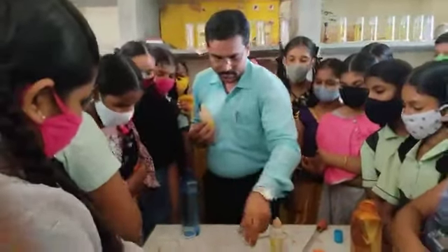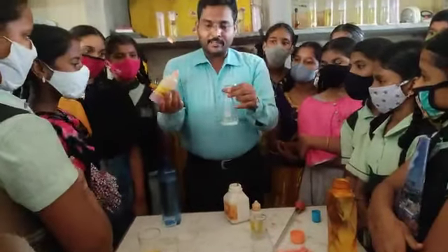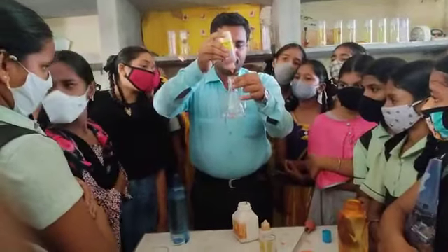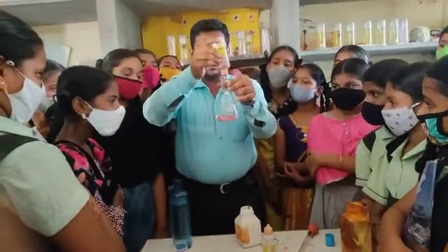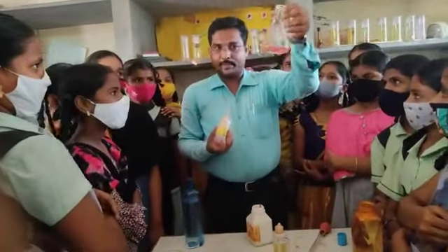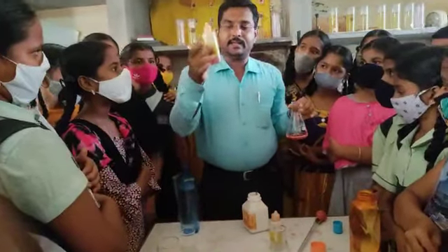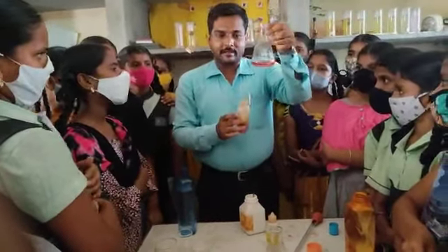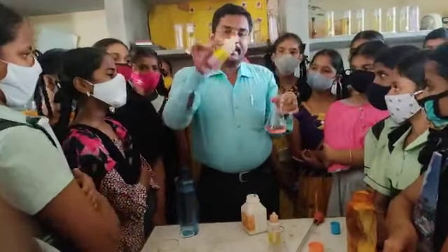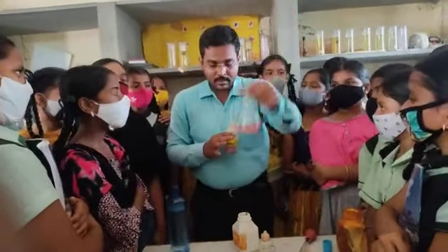Okay. Next, take the conical flask. The conical flask contains a solution. So add the methyl orange indicator to the conical flask, one or two drops. The color changes, no? Observe the change. Yes, actually not this pink color, red color. Red color. The color depends on the concentration of the methyl orange indicator. Actually it is red. Did the color change or not? So by adding the indicator you can confirm that the conical flask contains acid.